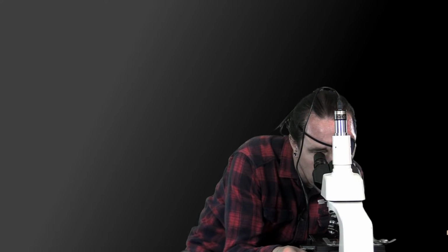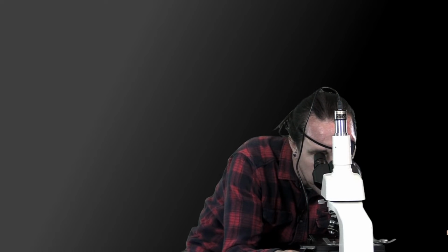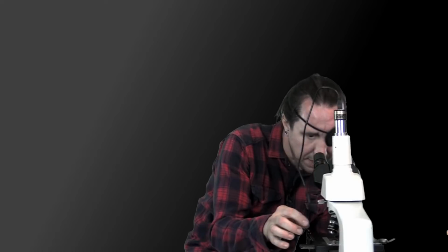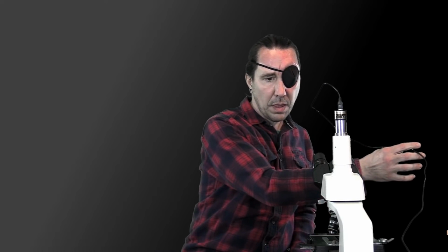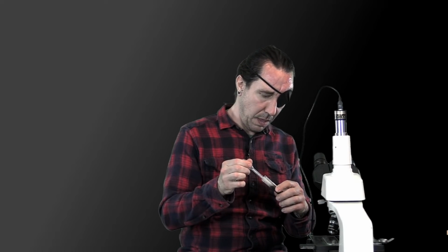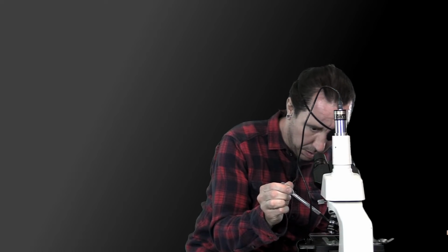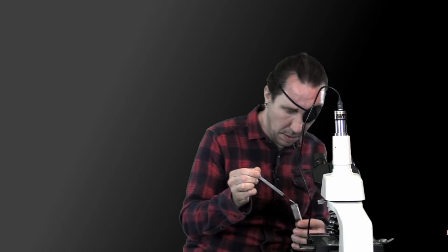Do you have that hooked up? Yeah, if you want to switch it over to the camera. This slide may have dried up a little bit, so I'm going to, hold on, give me one. Okay. Now, Dan, you might have to set the computer to duplicate the screen or drag the microscope screen to the other window. Yeah.